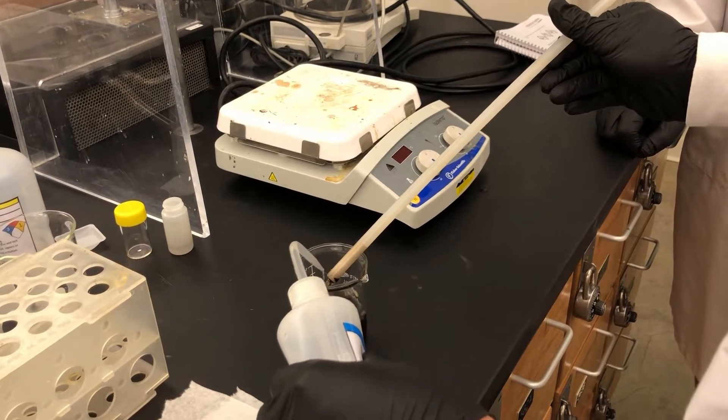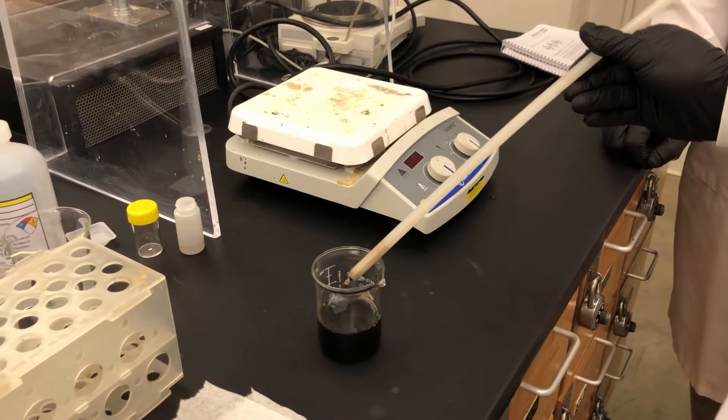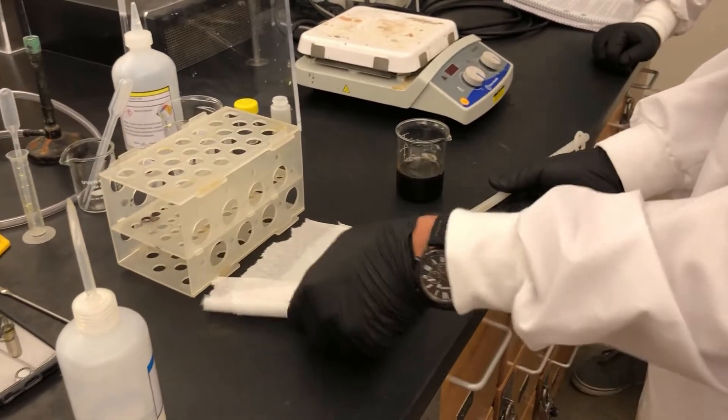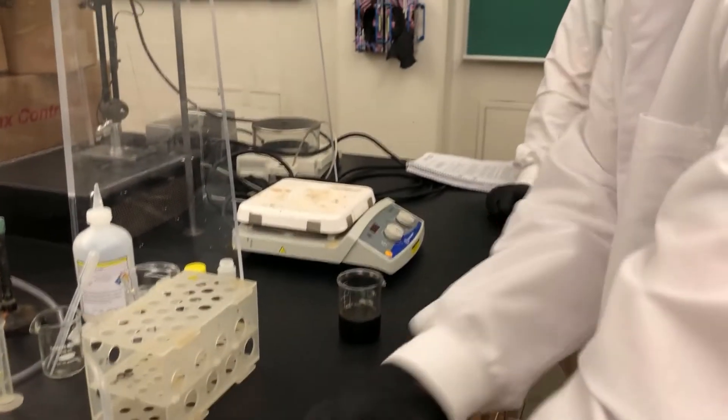Cause I want as many nanoparticles as I can get in my finished ferrofluid. Okay. That's probably the best that I'm going to get here. So I'll rest this down and I'll just pull it off.